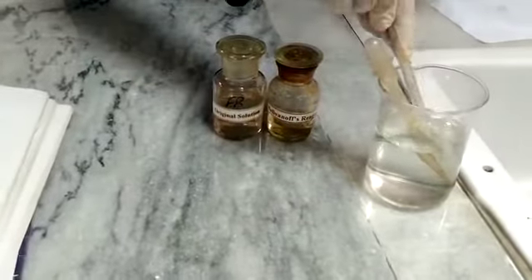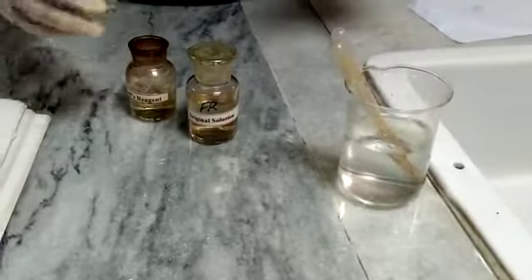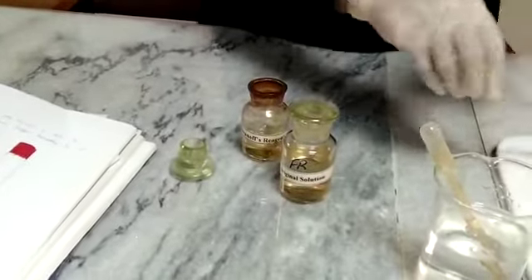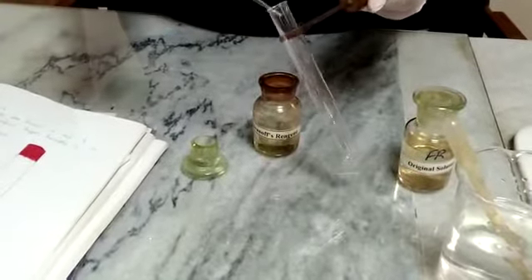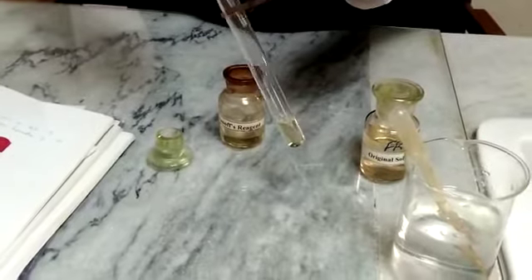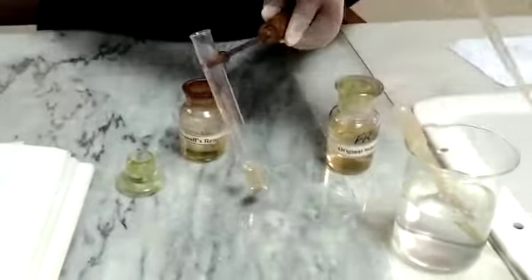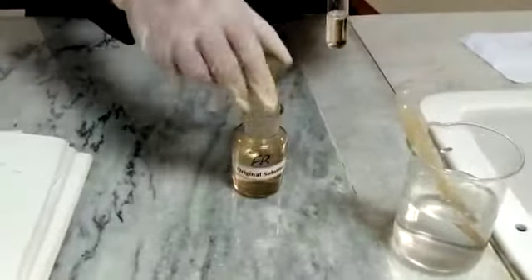We will take the test tube and adjust it with the test tube holder. After washing the droppers, we are adding 5 ml of Seliwanoff's reagent — first 3 ml, then 2 ml more, making a total of 5 ml. Now closing the lid of the Seliwanoff's reagent and setting it aside.